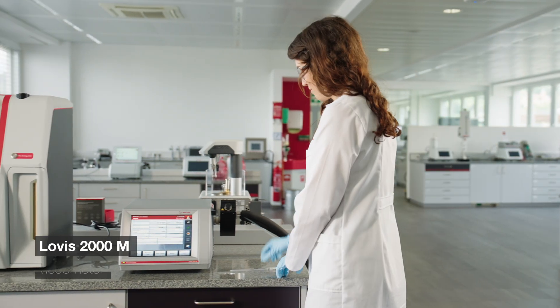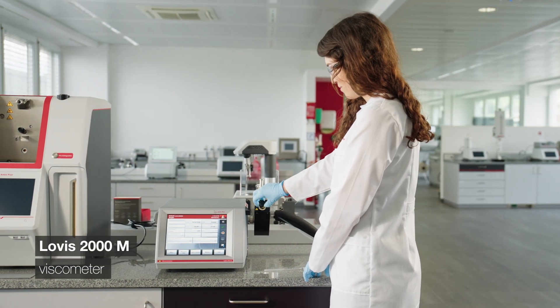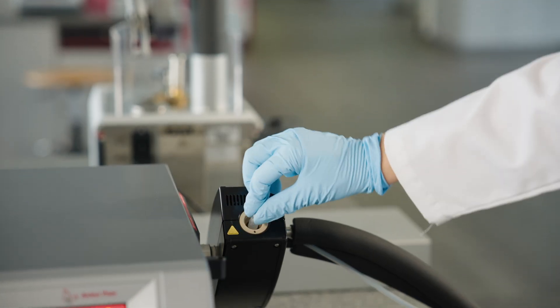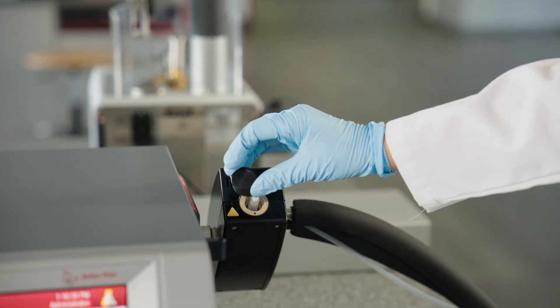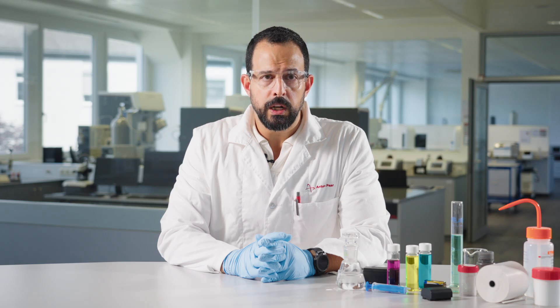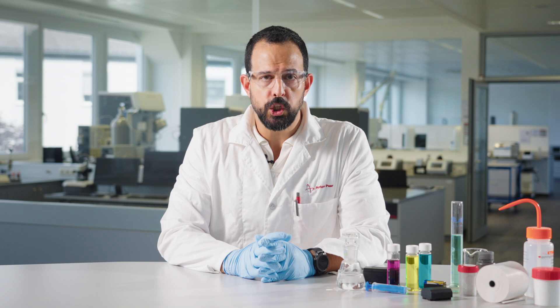Using a rolling ball viscometer with a cooling option, the dynamic viscosity of an electrolyte solution is measured. It is important to remember that battery electrolyte solutions can be very corrosive, and the reaction of electrolytes with water can form hydrofluoric acid or HF, which is extremely hazardous and corrosive. This is why it is important to select a system well suited for this application. If the electrolyte chemically attacks glass, the system should be equipped with high chemical resistant PCTFE capillaries.